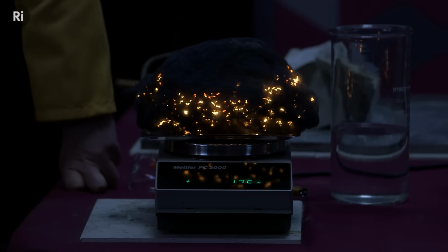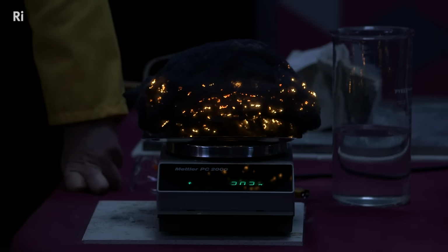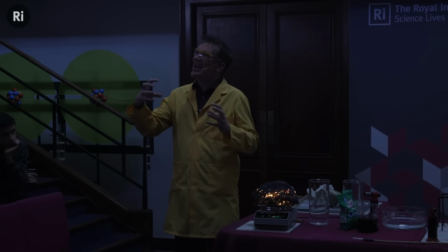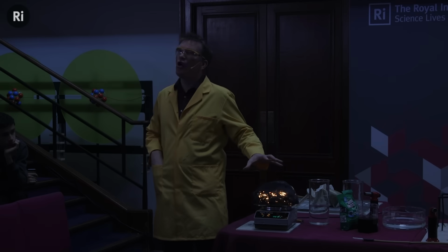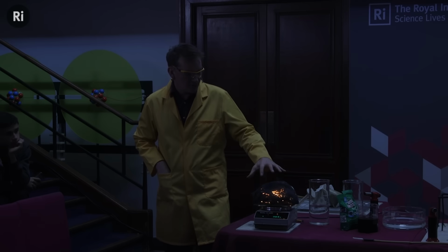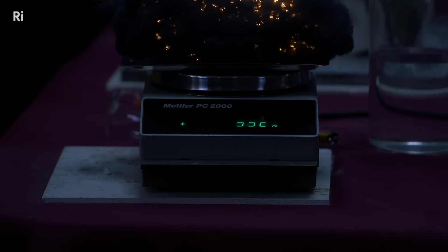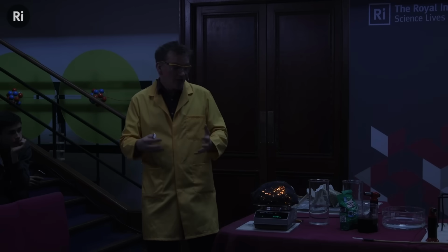And why is this? Well, none of the iron has disappeared. It's still all there. However, it's now combined with the oxygen from the air. And so we haven't lost any iron. What we've actually done is gain some oxygen, and we've formed iron oxide. So the mass, of course, is heavier because it still has the iron, and now it's also got oxygen built into this structure that we have here, this solid. So it's over 3 grams heavier now due to the combining mass of the oxygen that's now trapped into the solid here.